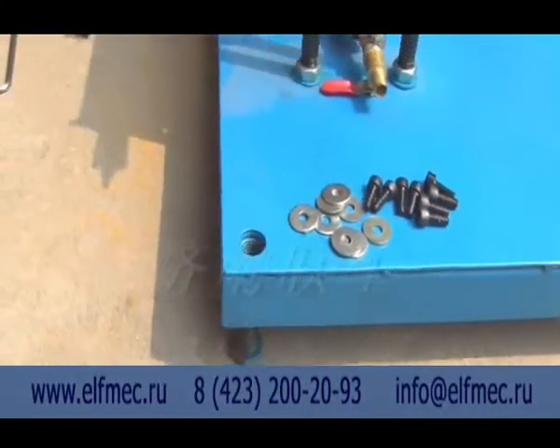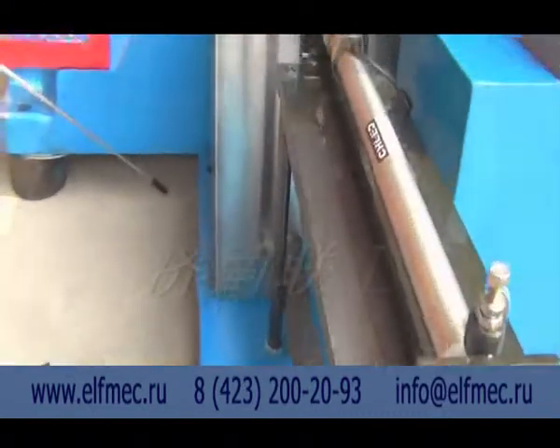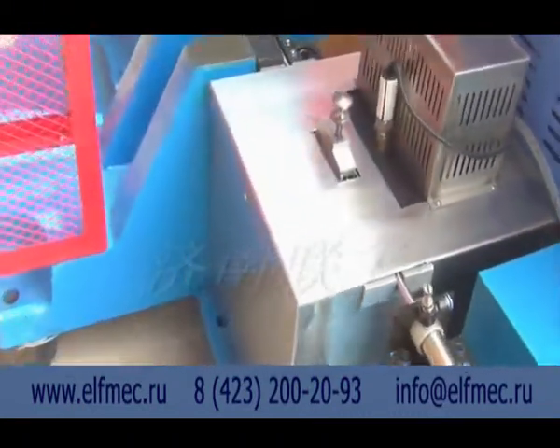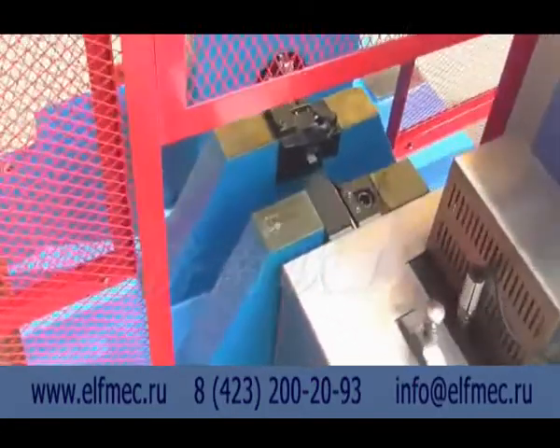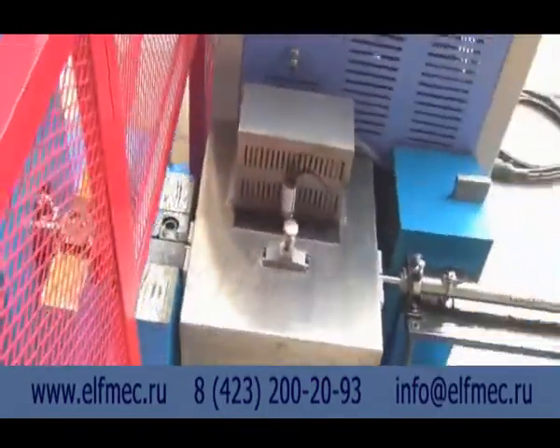When putting samples into the sample boxes, we need to notice that all the sample gaps should be in the same direction. The gap direction should be in line with the pendulum impact direction.